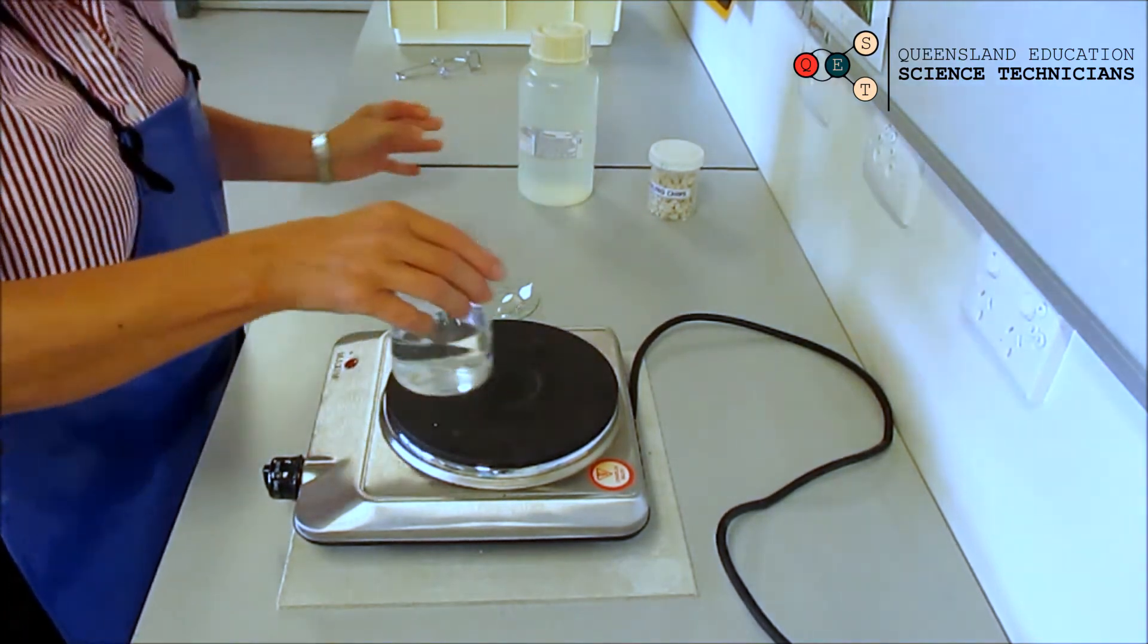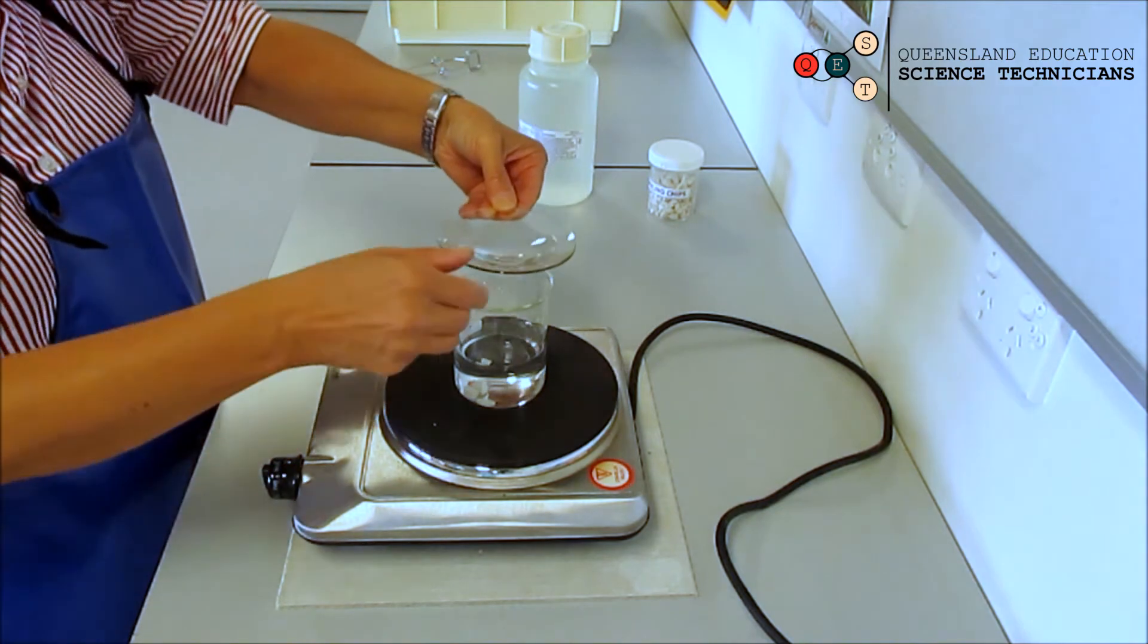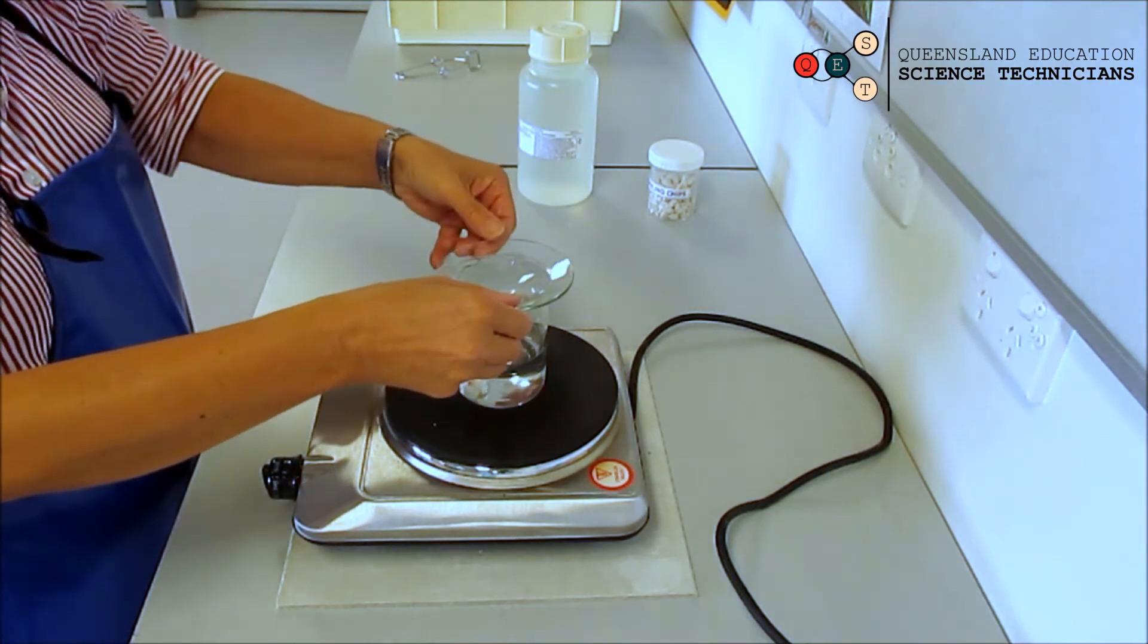Then you will put your beaker on your hot plate and your watch glass on top of your beaker like that.